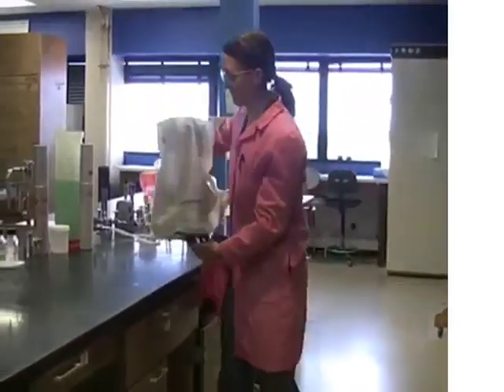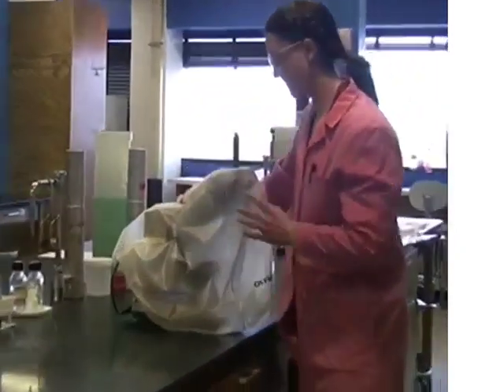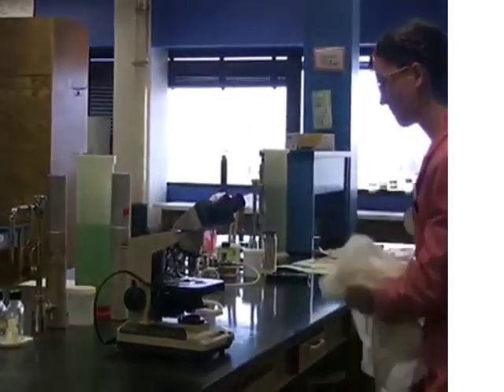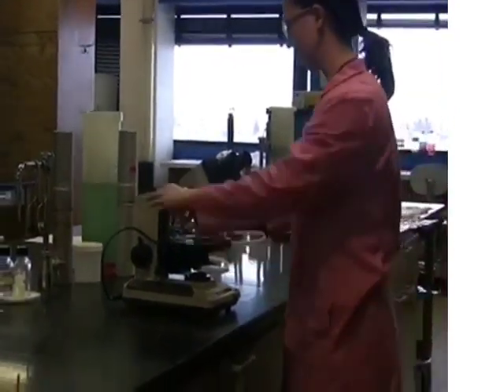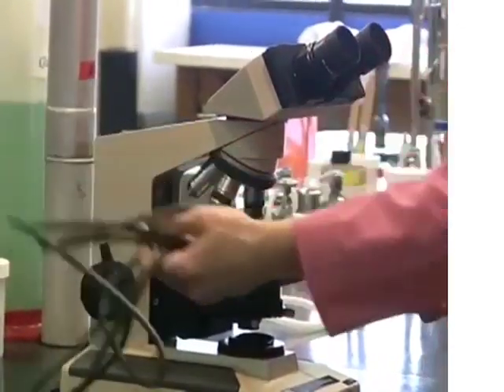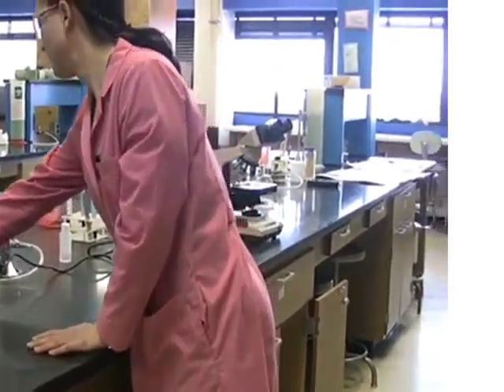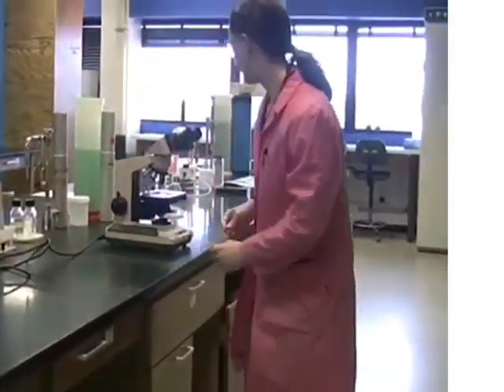There are little rubber footies on it that really jar the lenses if you do so. Also, you'll notice that if your microscope was stored correctly last time, the cord will be bunched in between the arm and the stage — never wrapped around the arm. Go ahead and begin by removing your cord and plugging it in.